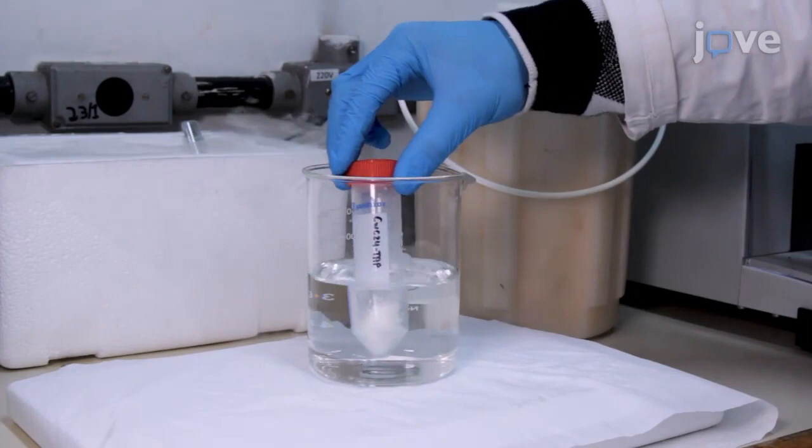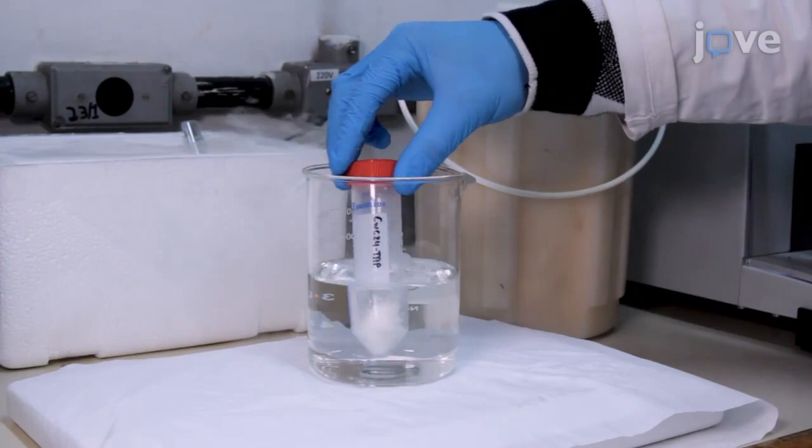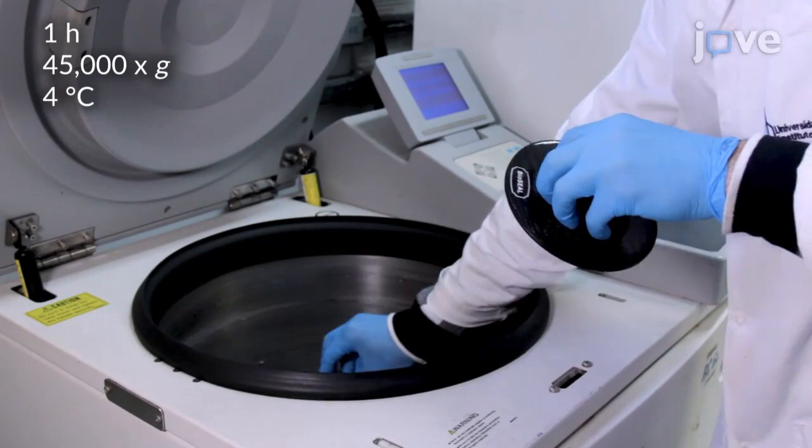After the last cycle, place the tubes containing the extracts into water at room temperature with occasional shaking. Once melted, centrifuge to collect the extracts and quantify the protein of the cleared supernatants by the BCA method.